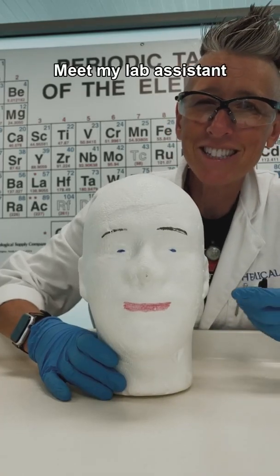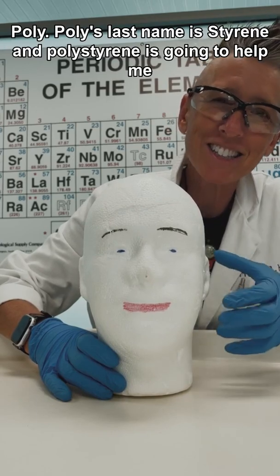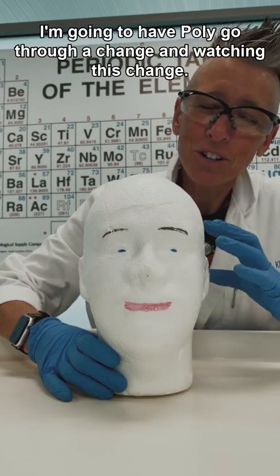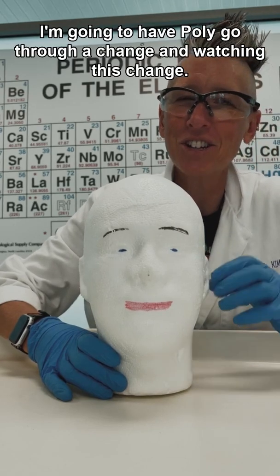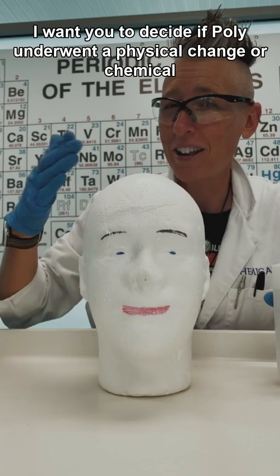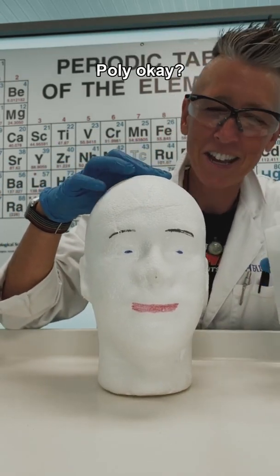Meet my lab assistant, Polly. Polly's last name is Styrene, and polystyrene is going to help me with a chemistry demonstration. I'm going to have Polly go through a change. And watching this change, I want you to decide if Polly underwent a physical change or a chemical change. Are you ready, Polly? Okay, here we go.